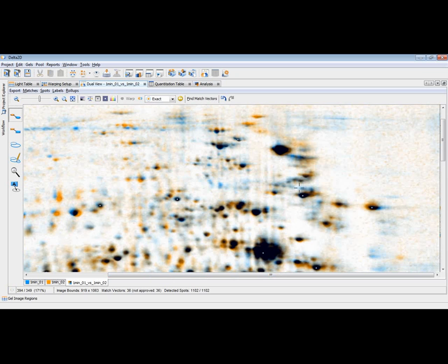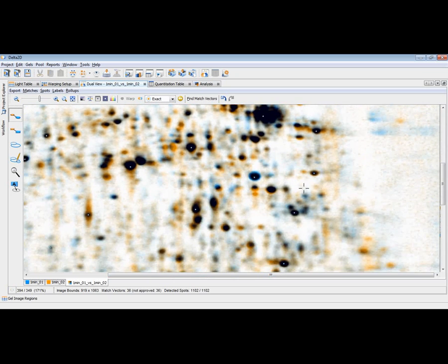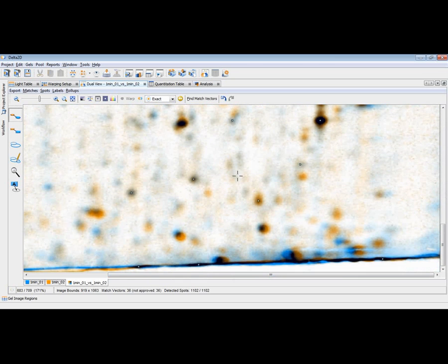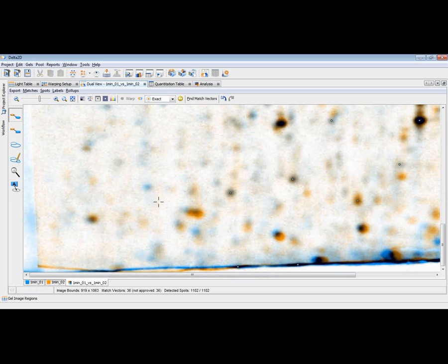We never said warping will be done automatically for all possible images, but I think, as you can see here, it's done for a large area. It's ready, it's fine with that. And we just have to improve it at the corners at some situations where Delta2D couldn't find proper matches. How to improve that? We can now use this position as the starting position for another automatic warping. If I now say automatic and let Delta2D warp again, it would take the existing match vectors. Of course, we could delete those match vectors which have been found by error.